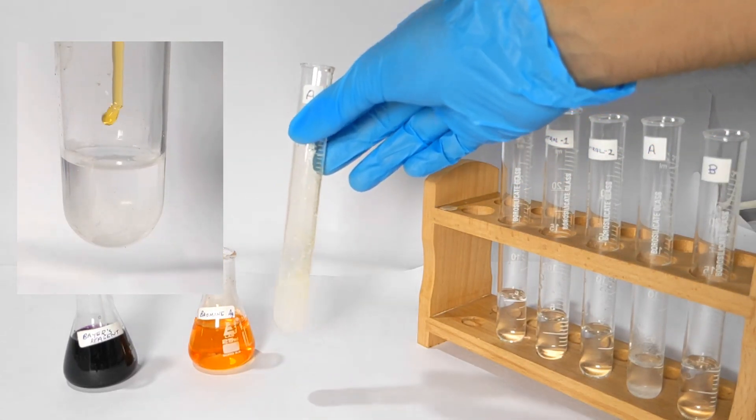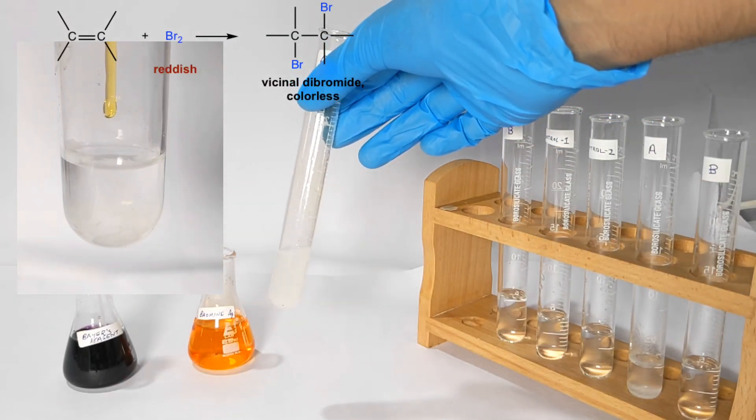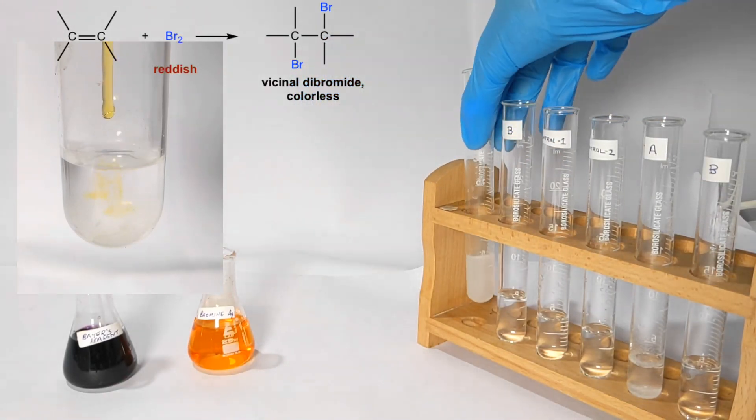This is a positive test because unsaturated organic compounds react with bromine forming vicinal dibromide.